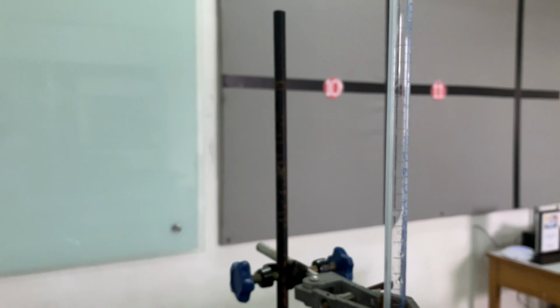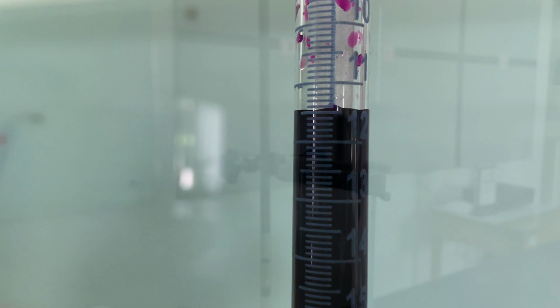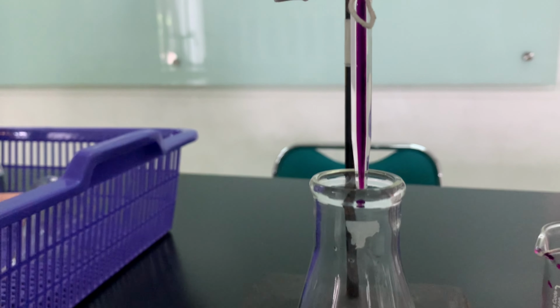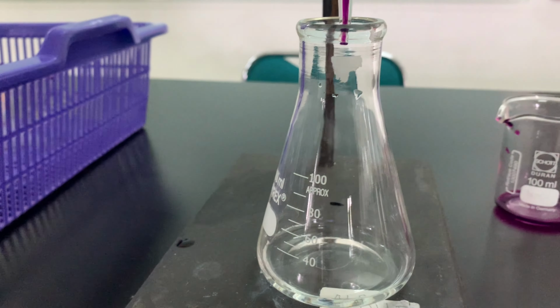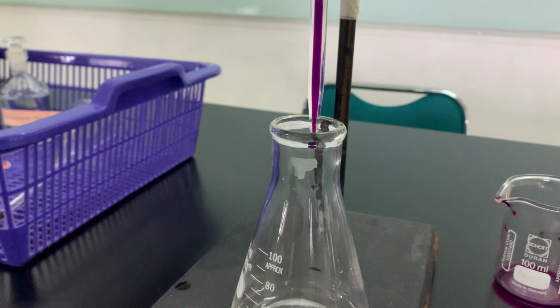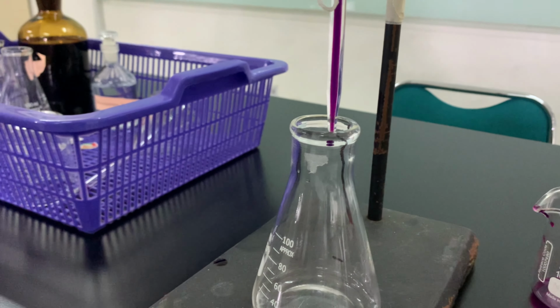Redox titration can also be used for investigations such as determining concentrations of dissolved oxygen (DO) and biological oxygen demand (BOD), where those two indicators can be used as a good sign of pollution in a wastewater sample. However, you need to understand some key factors in this redox titration first.